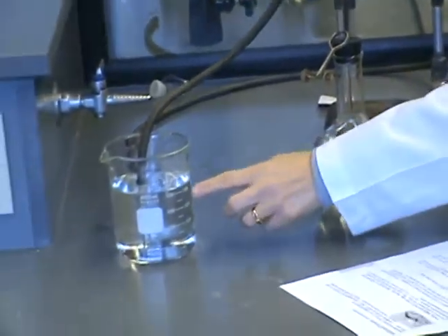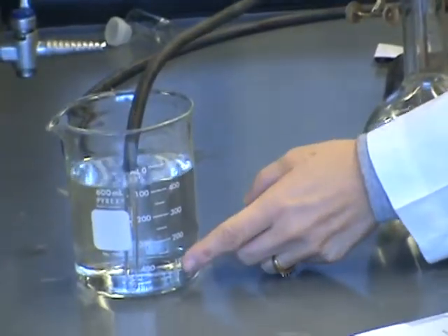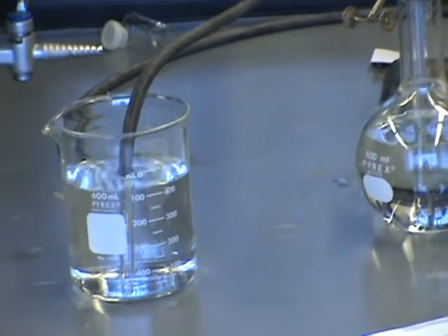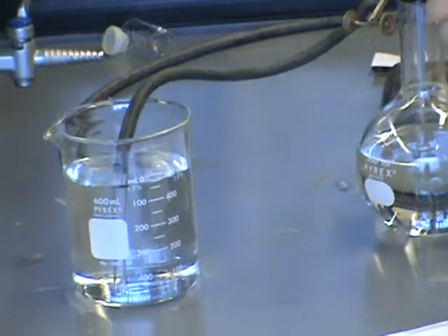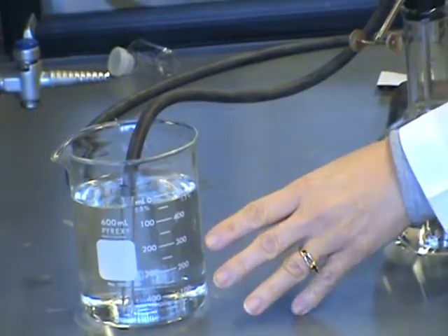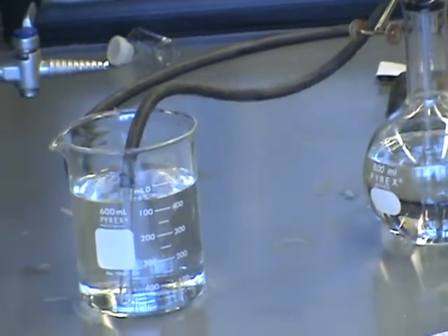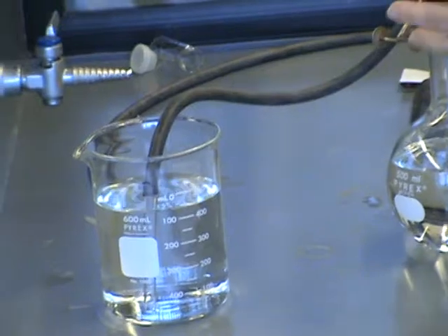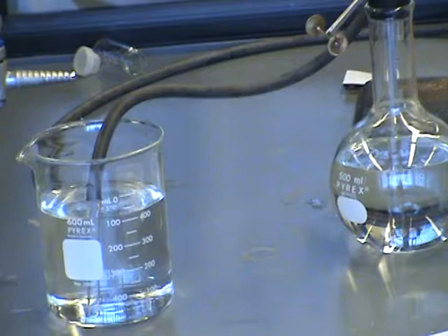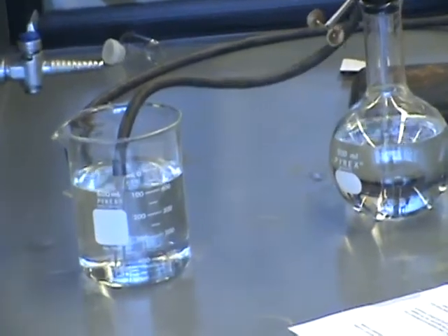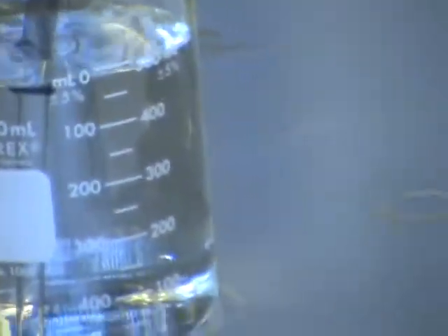What you're watching for is you should see a bunch of air bubbles kind of going glug, glug, glug out of this opening over here into the beaker of water. That's what I was looking for. When I see those air bubbles, that's a good sign. That means I'm blowing the air out of that tube. I'm going to blow one more time really hard just to make sure I get all those air bubbles out of there. So this time when I blow, I may or may not even see air bubbles. So let's watch and see. Okay. Looks like that's pretty good.